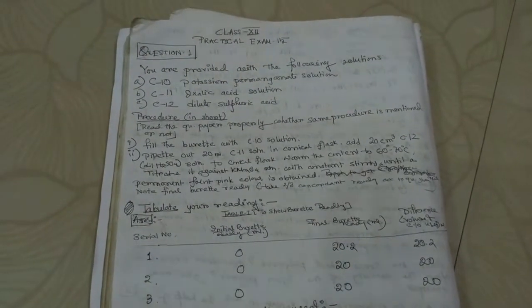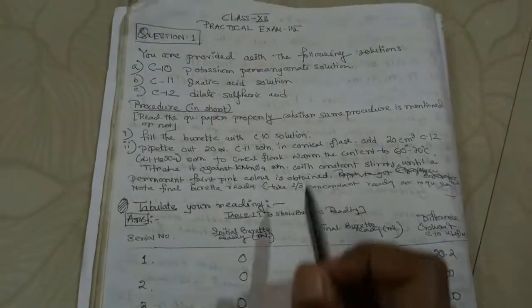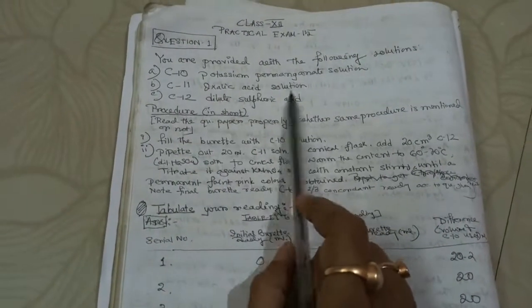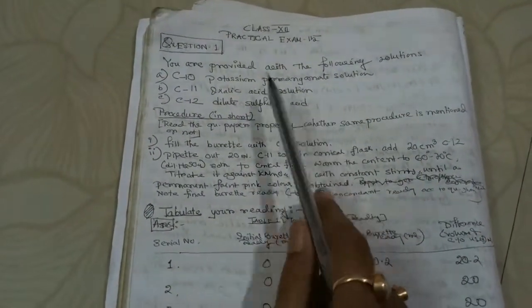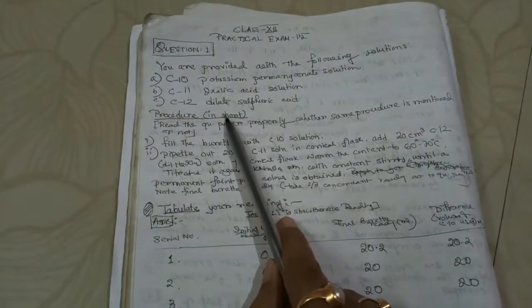Hello everyone, today our day 4 of practical class and today we will be doing this practical that we started previous day, that is potassium permanganate and oxalic acid which is acid catalyzed.